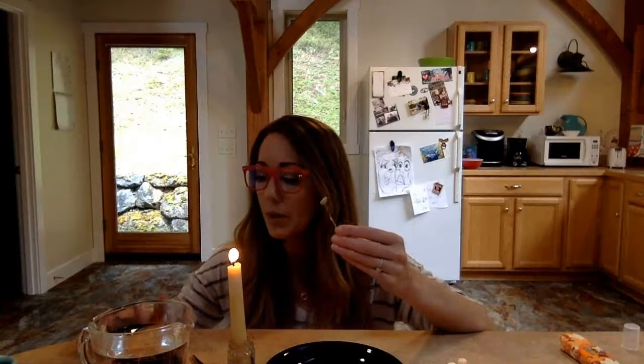Skewer my cashew here. Set my timer. All right, I'm gonna hold it. Wow, now it smells like s'mores. This isn't fair. Okay, I'm gonna hold it over my candle. It doesn't have the flame yet. Oh, now it has the flame. I'm starting my stopwatch and letting it burn.